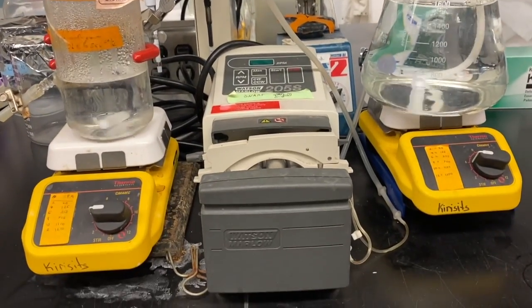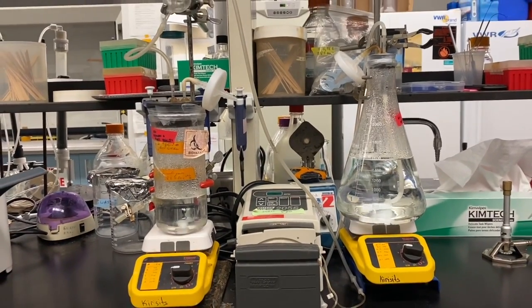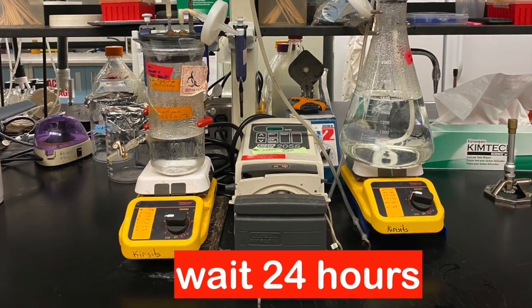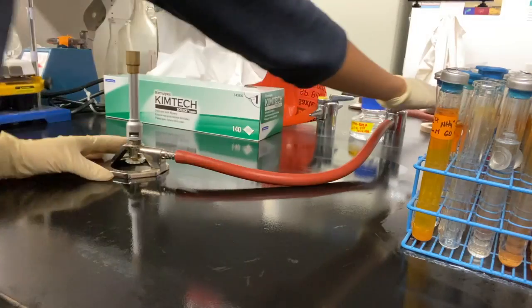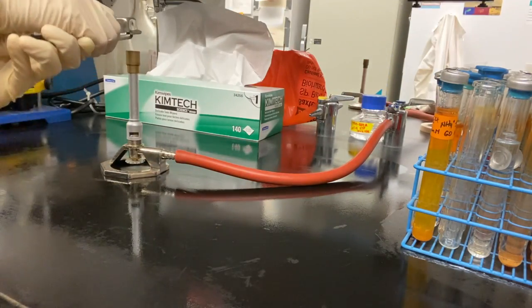Both stir plates are turned on and set to the setting of 4. At this point, there is no bacterial growth, and the chemostat will sit for 24 hours to ensure no contamination. After 16 of the 24 hours have passed, we can now create an inoculated liquid culture of our target organism from the streak plate we had created earlier.